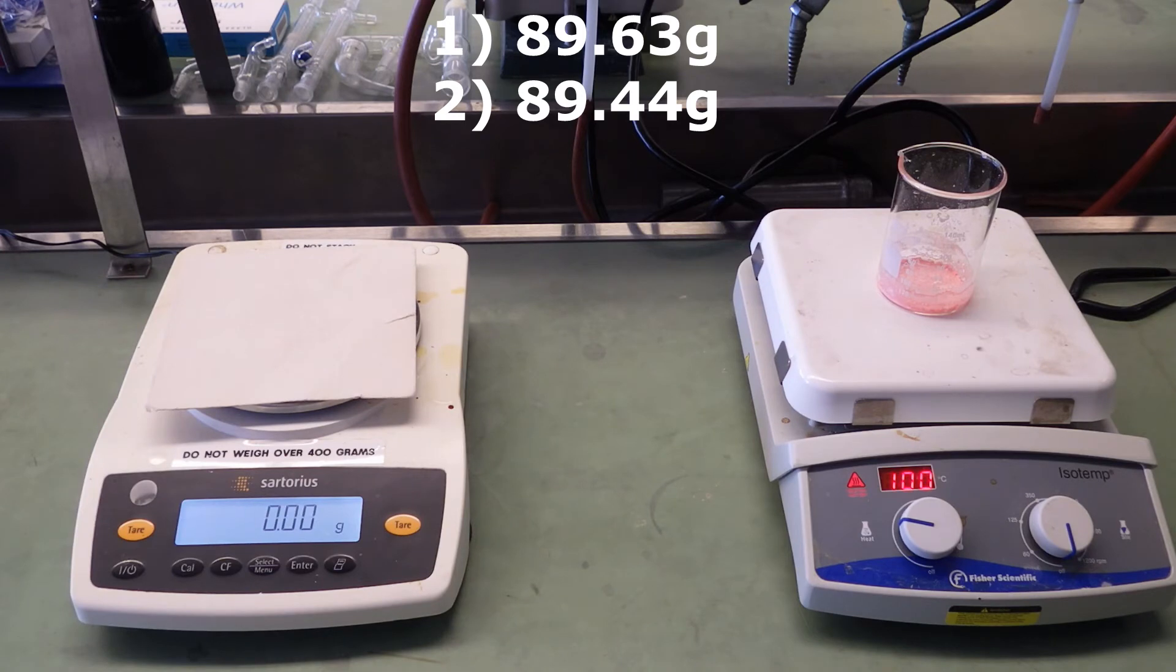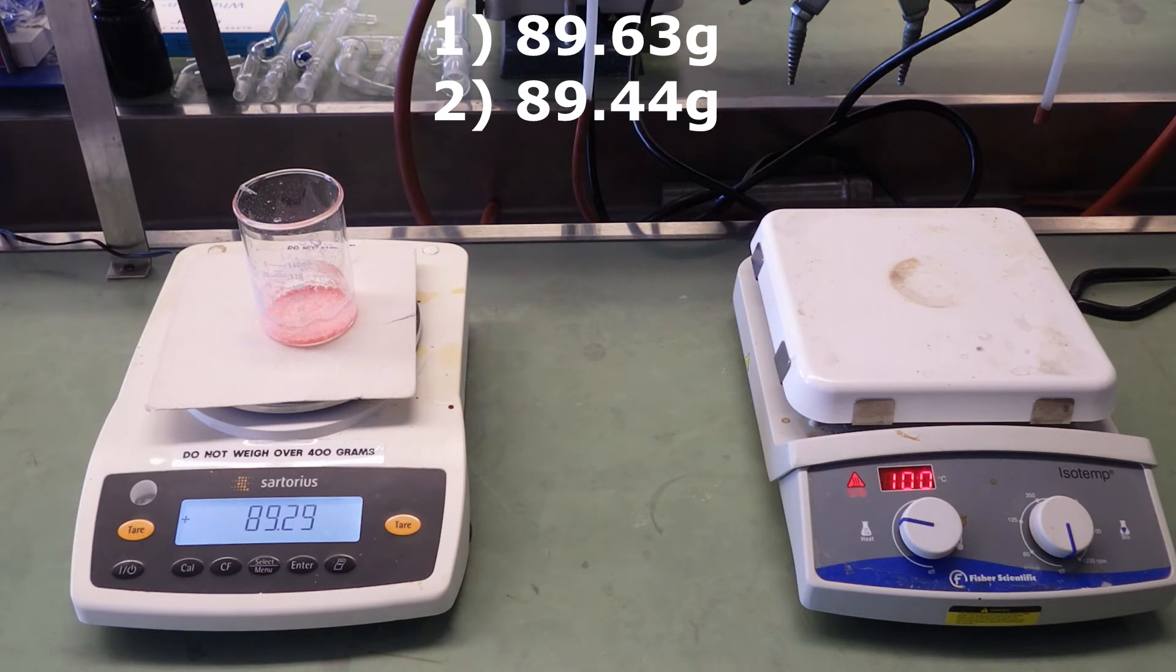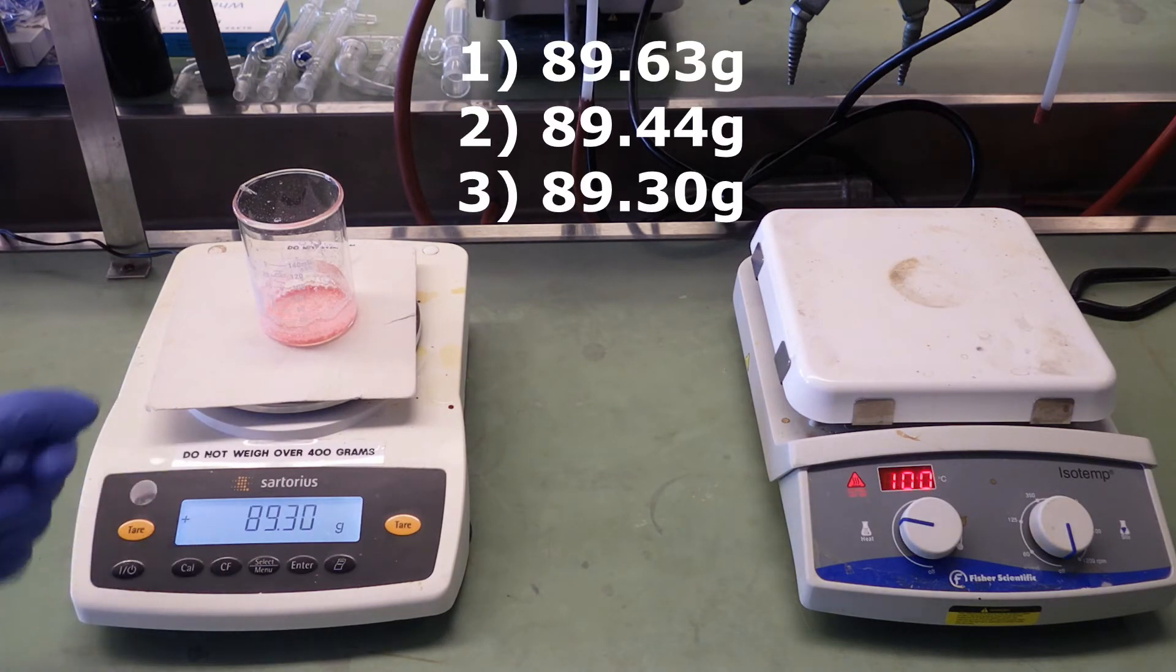Here's our third mass now, after more time. 89.30 grams.